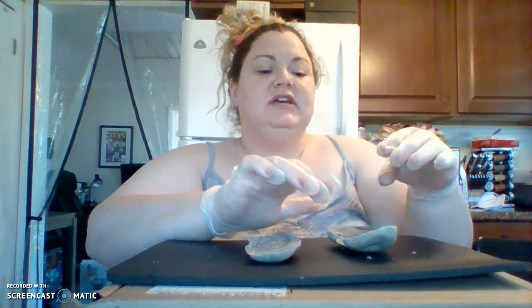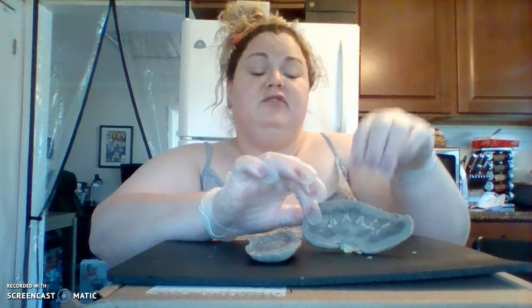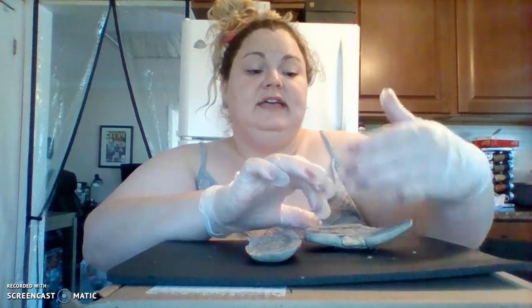Now, as it gets filtered through the layers, they're actually filtered based off of their size and shape throughout each layer, and that's how each one takes care of filtration.